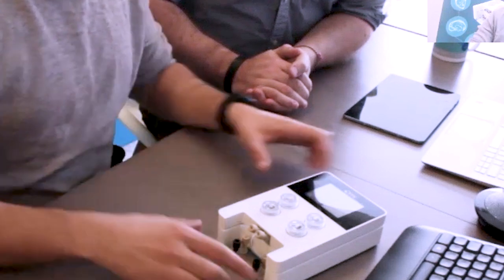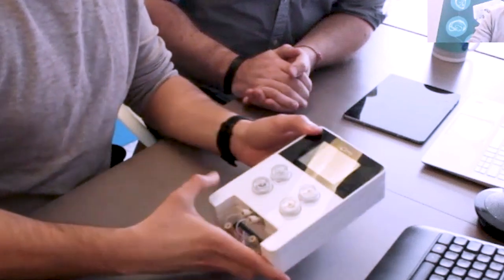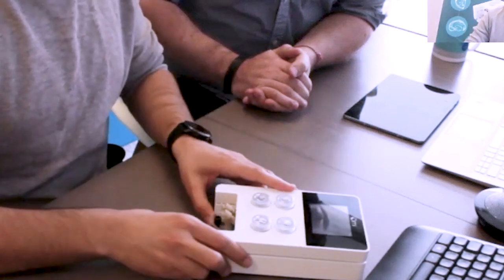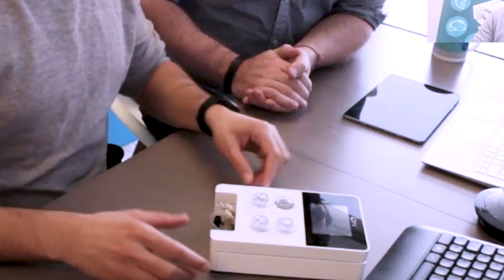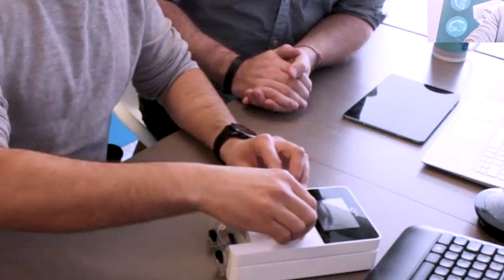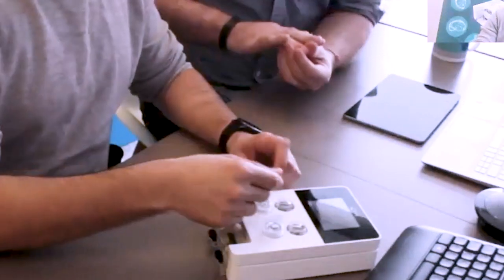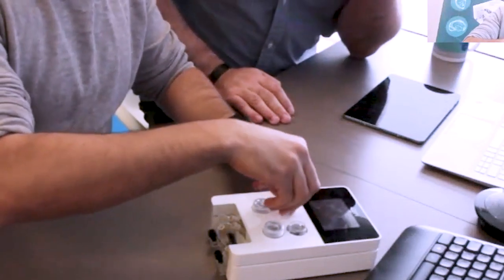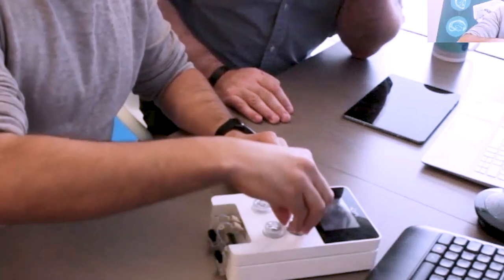Here I have my setup. Now, if I want to make an experiment, I can directly fill my reservoir by opening, as we saw in the video, the reservoir RI here. And if I want the recirculation, I will inject some fluid inside and close it really tight to make sure that I have no leakage in terms of pressure.